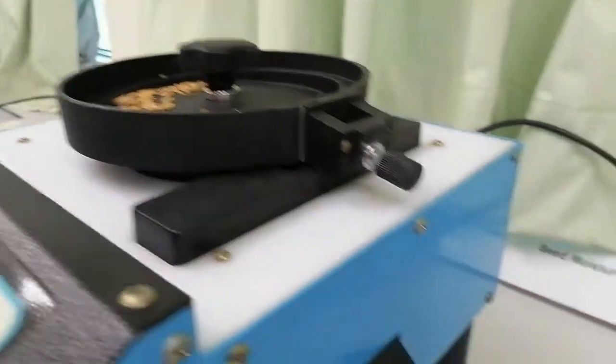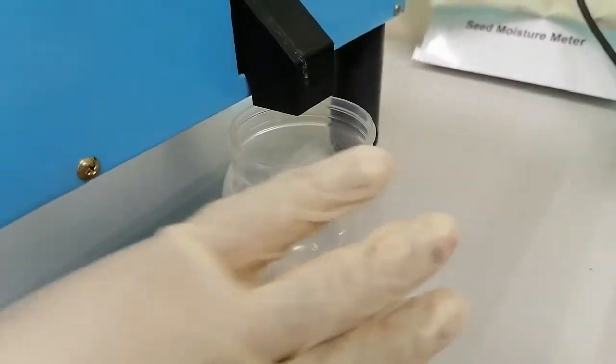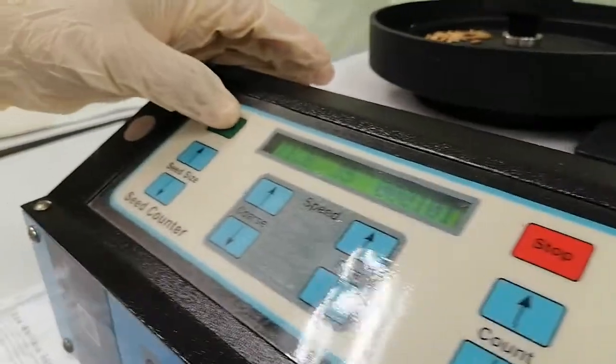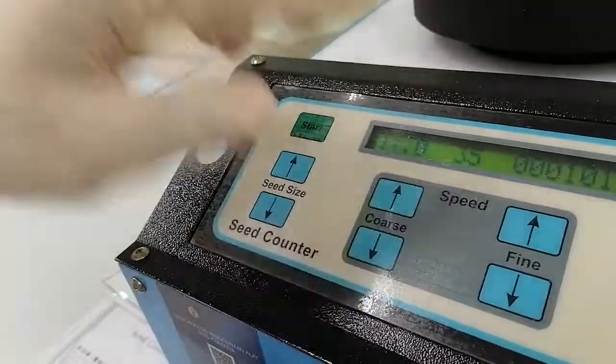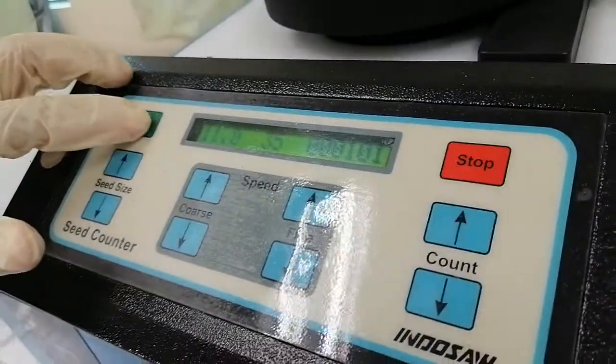Now there is the outlet. So one by one they will reach here. When we press the start button, this is a start button and off button, so we just start.